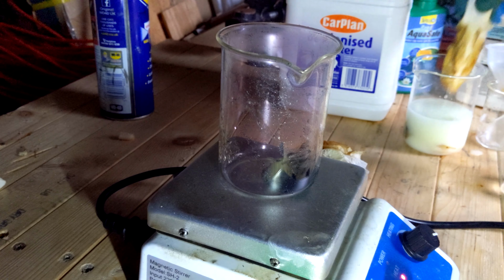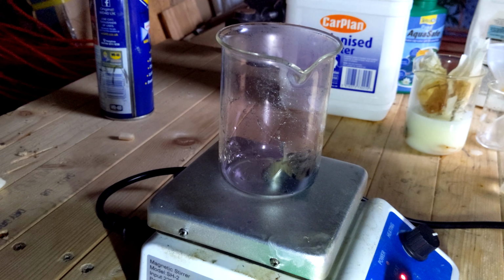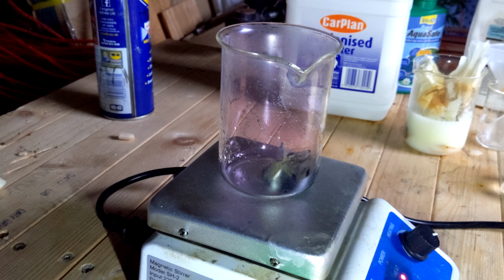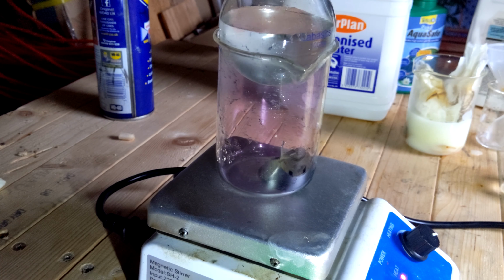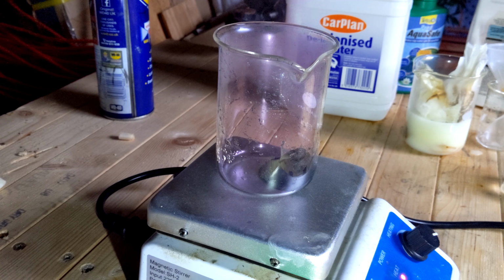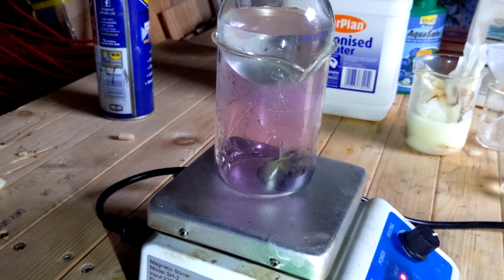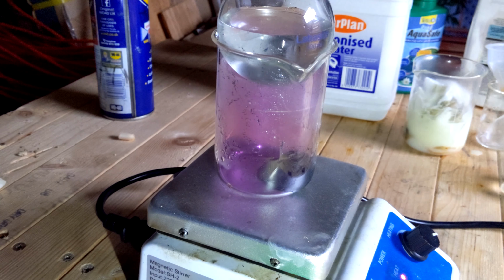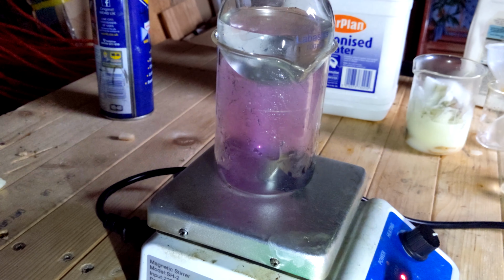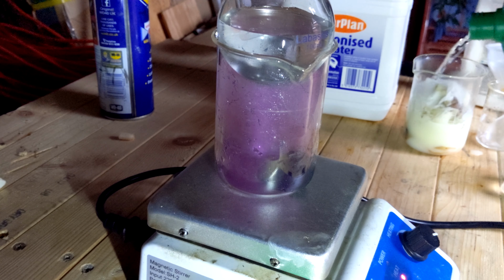So I do lose some iodine here, which, as you can see, the solution does destroy. But it's not much. There's not much value in trying to recover that iodine, so, sod it. Then you see the fumes picking back up as I put it back on the hot plate with the round bottom flask again. Any paper is put in the solution to destroy the iodine stains.